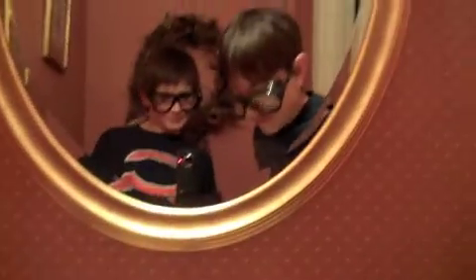The glow is stuck pretty much. Looks like the copper wire has some catalytic effect on this — that's why it failed the last time I tried it. You know, this is the only light in here besides the camera light. You have the door completely closed. That's cool, and it's a nice blue glow too. That's why I've been told we are supposed to wash this out with a lot of water.